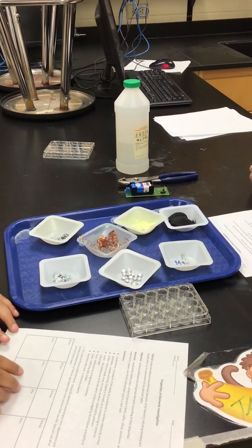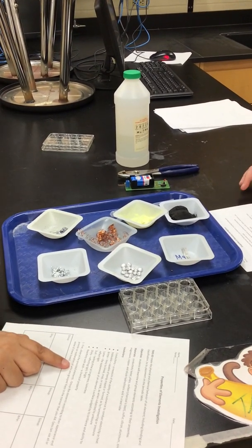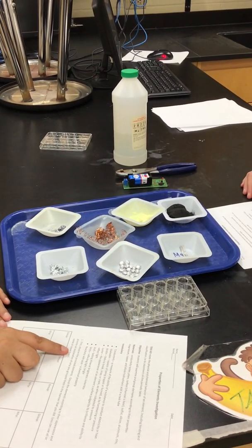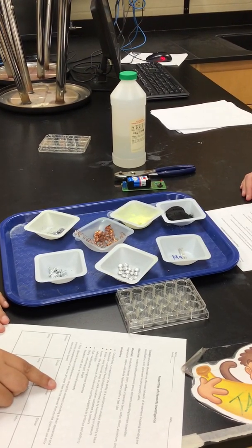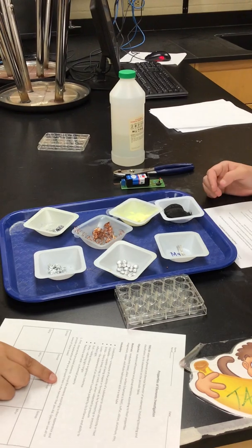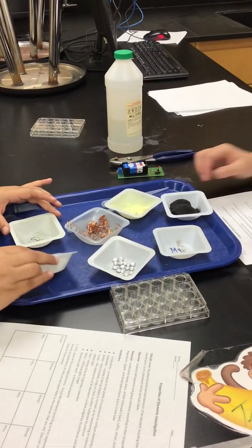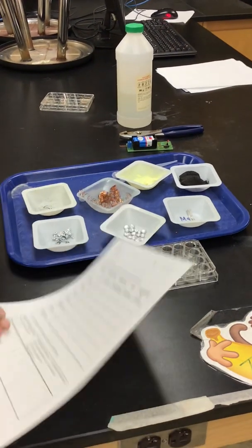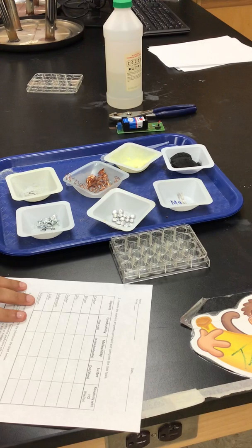Okay. So first we have to observe the proper elements, group them according to their appearance, and provide an explanation of why we grouped them in the manner that we did. So we're going to do that. I'm going to look at them. Okay. All right. We grouped them. Y'all do that at home. Just saying.